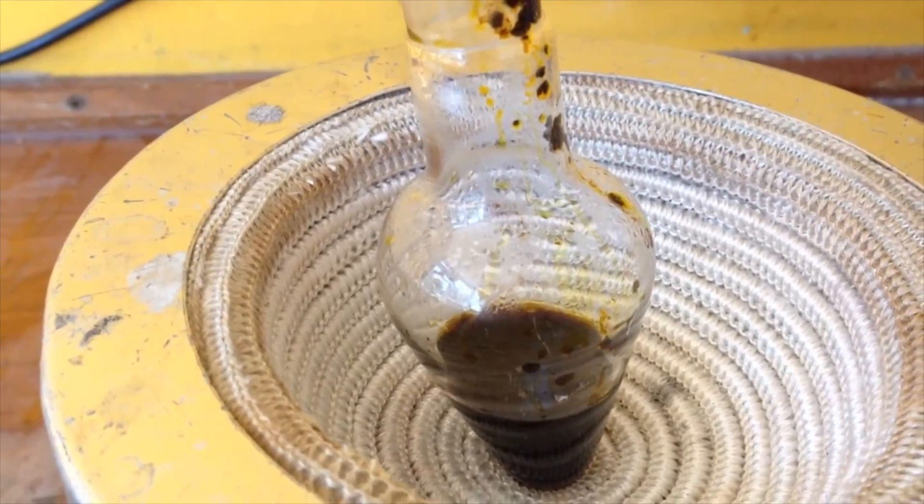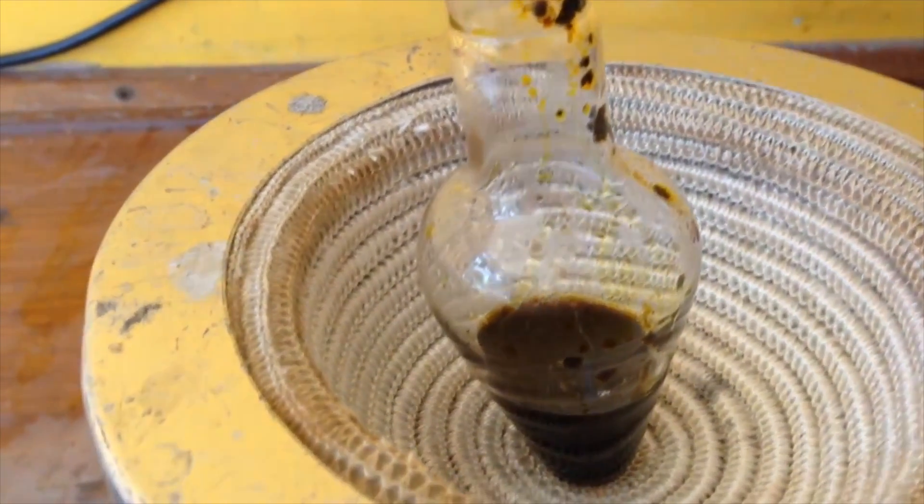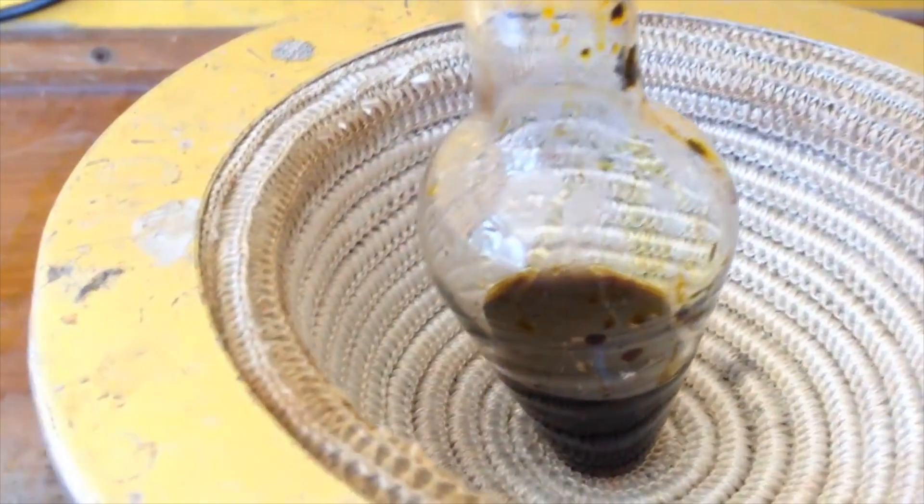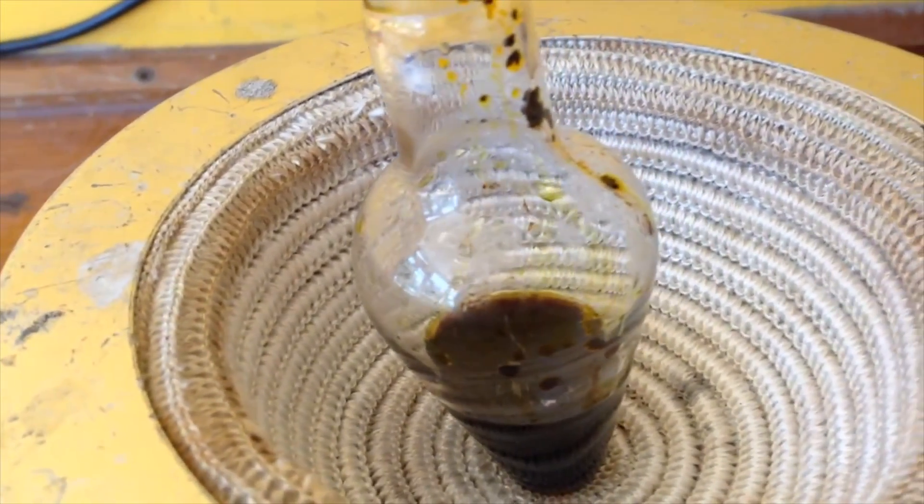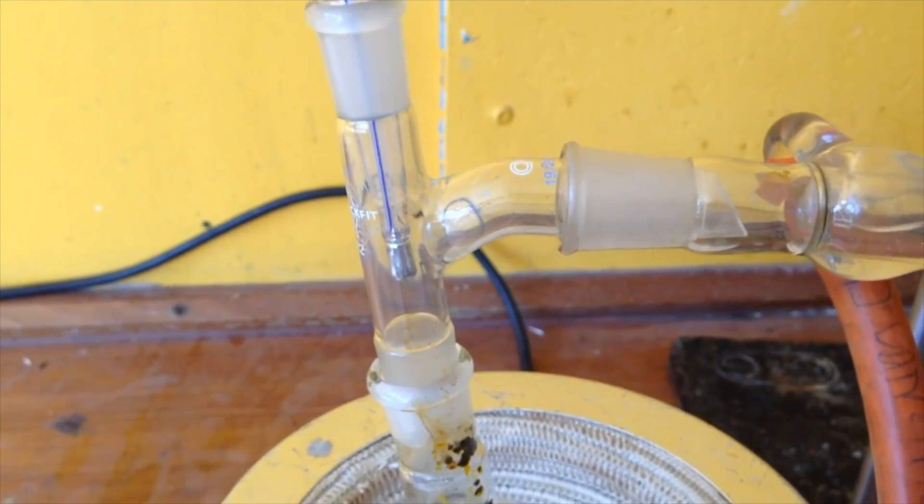So a big part of chemistry is patience. It's been about 10 minutes now and you can start to see some condensation forming on here but nothing as yet has made it up this far.